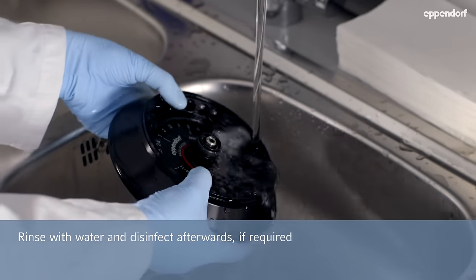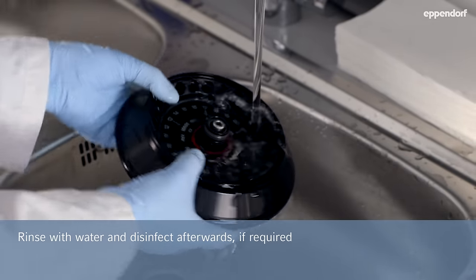Rinse the rotor with water afterwards, but avoid dipping it into water completely.